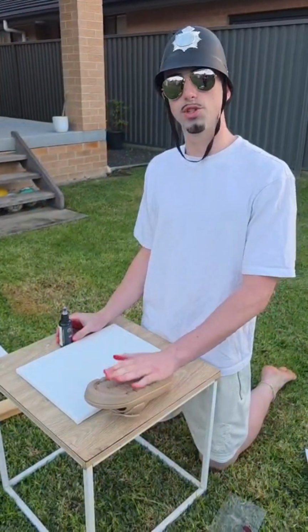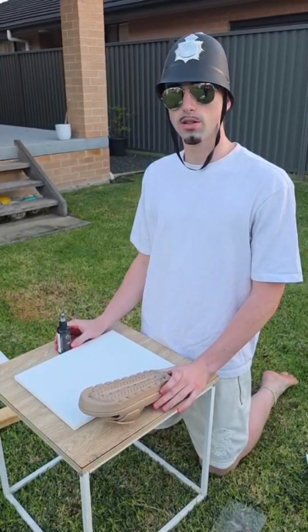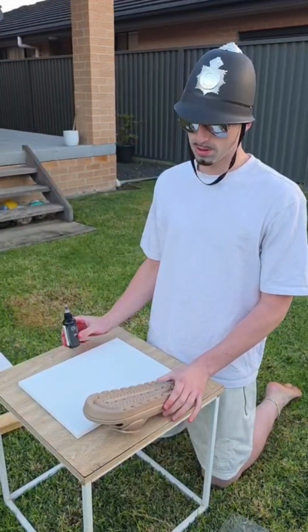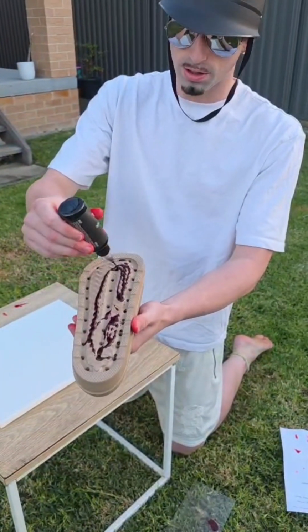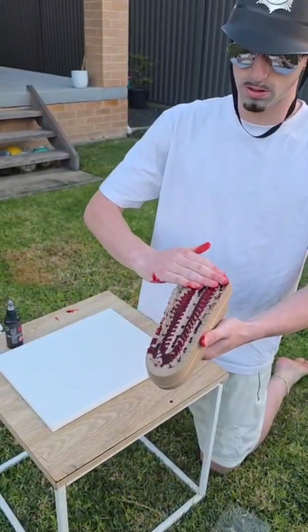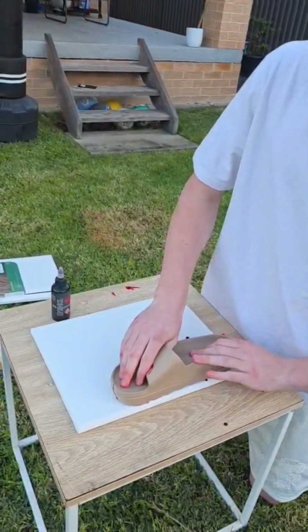So this is another example of a transfer stain. We're going to use this shoe to show an example of someone walking through a crime scene, which can show forensic scientists where they have gone. So what we're going to do here is just add the blood all over the shoe, smear it on, and then just apply it to our canvas.